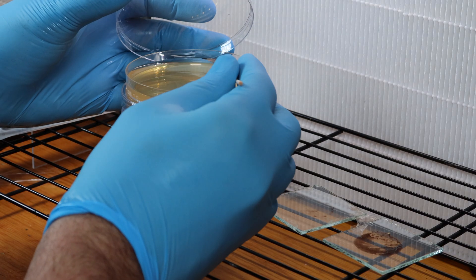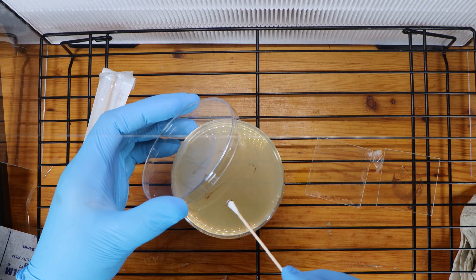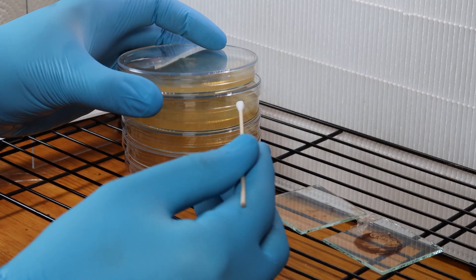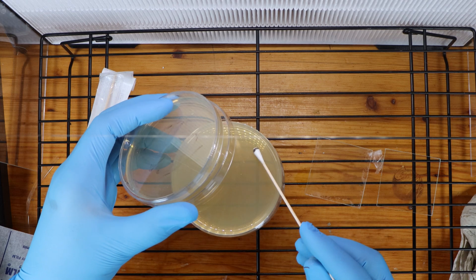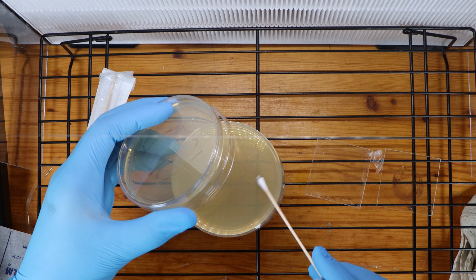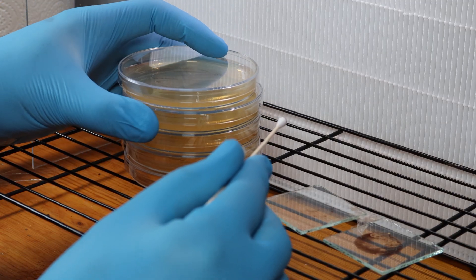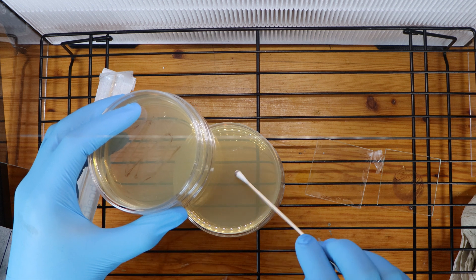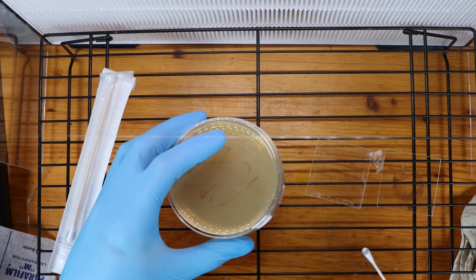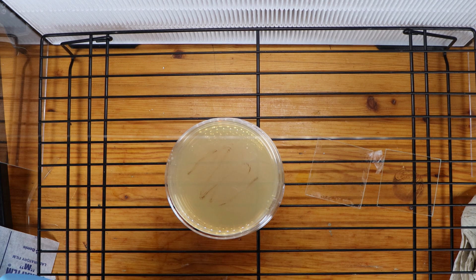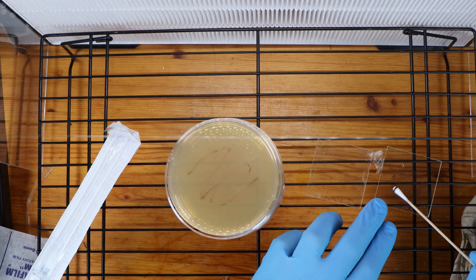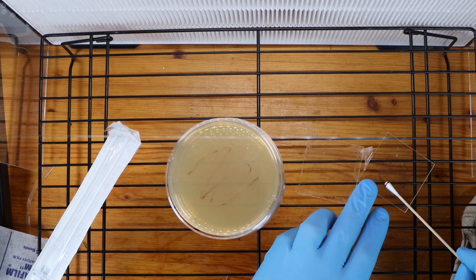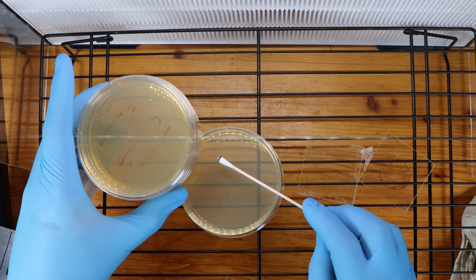I'm working top to bottom here so you can better see what I'm doing. Gently applying spores to each petri dish, being careful to have each dish open as little as necessary, and being extra careful not to put a big fat finger right inside your lovely sterile plates. Also you want to be aware of your arm movements and not have anything that should remain sterile under your arm, having your arm travel across the top. That can cause unnecessary contamination now or later on down the line with your spore print.